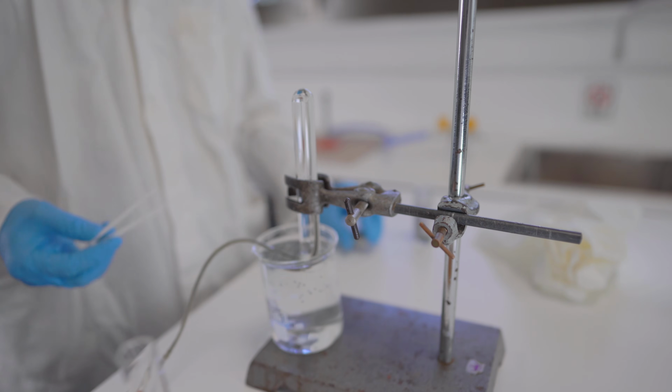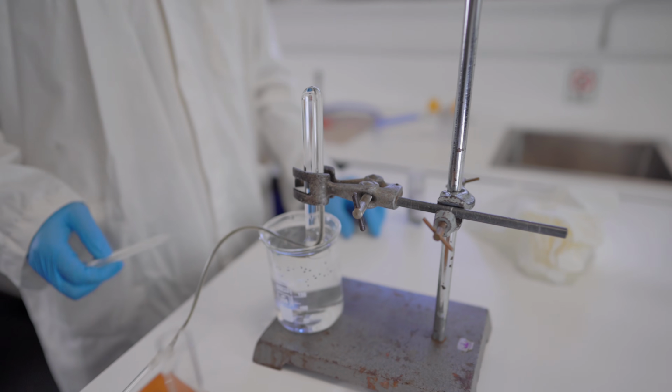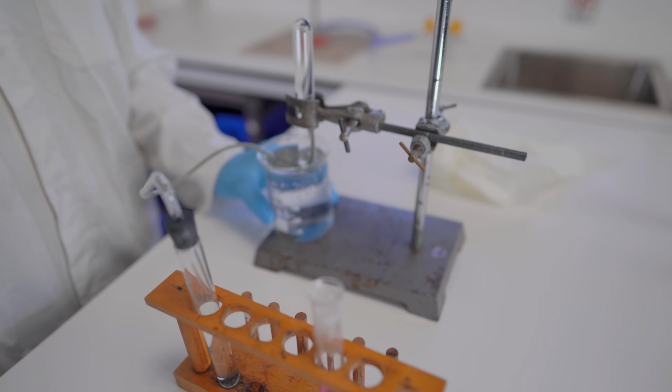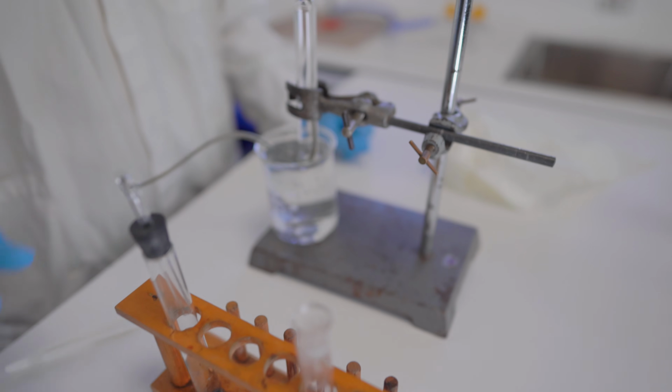Then we're going to do a flame test to see what kind of gas that is. I've already given you a hint that it's hydrogen gas, but Mr. Bowman could be wrong, so we could do a flame test. If it's not hydrogen gas, you could blow the flame out, or it could just be a boring result. We'll find out momentarily. Let's give this a shot.